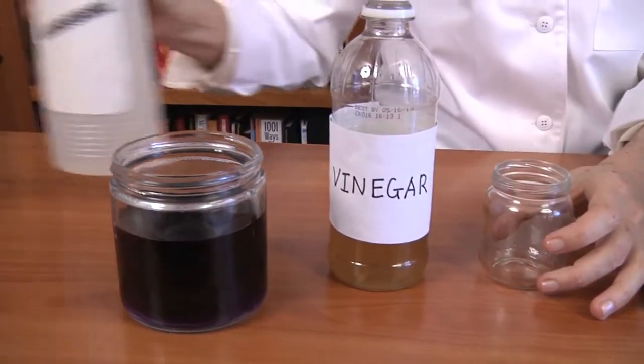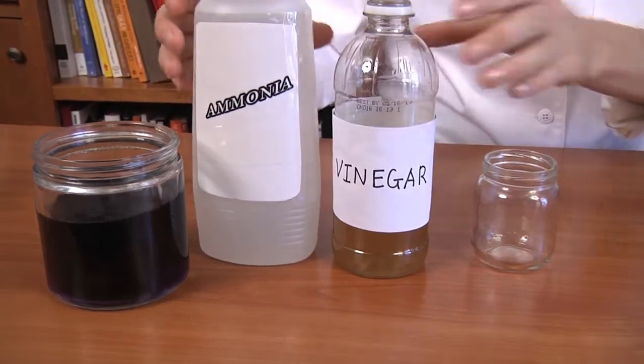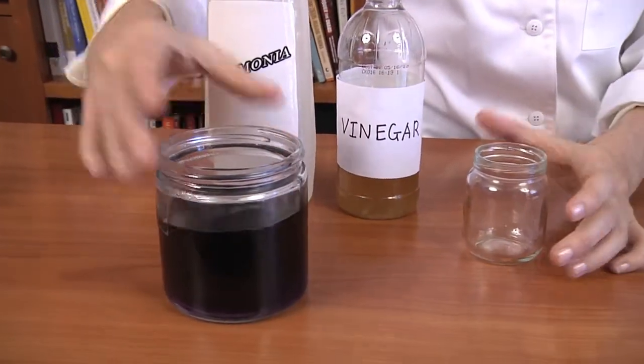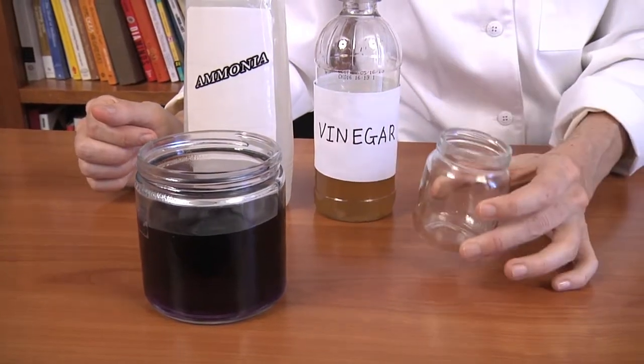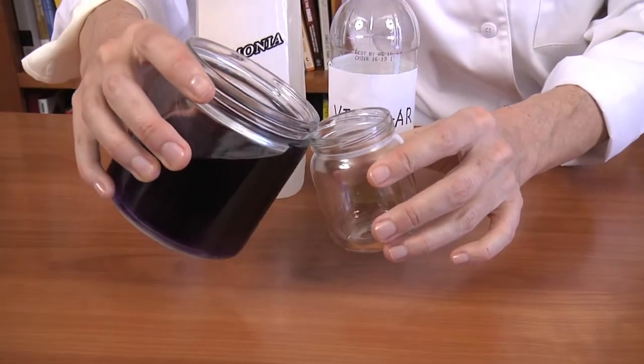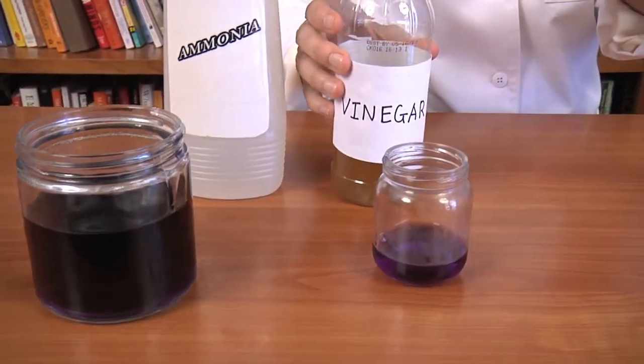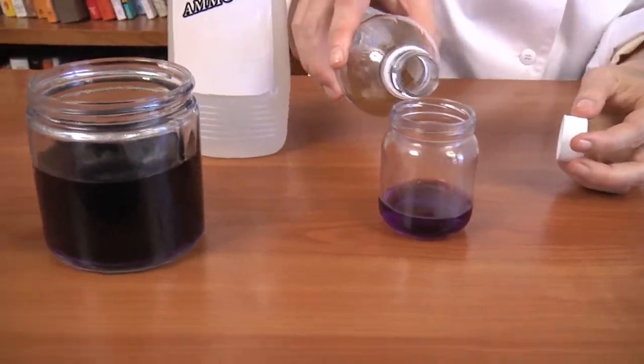By now all of you know that acids and bases react with each other. And one of the interesting things that we can observe during a reaction is actually how it happens. So if I take a little vinegar and I take ammonia and I add these two together, we will get a chemical reaction. And if I add some red cabbage juice indicator to my reaction beaker, I can actually watch the reaction happen. So let's add a little bit of indicator to the flask, and if I add a little bit of vinegar, this should turn bright pink telling me that it's an acid.